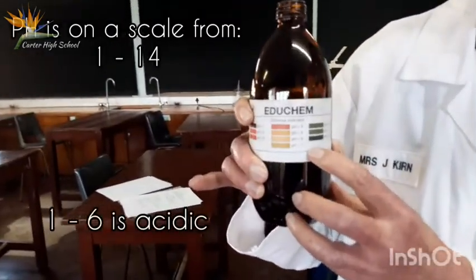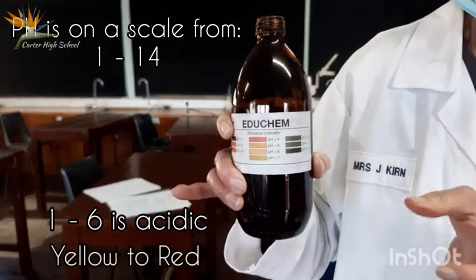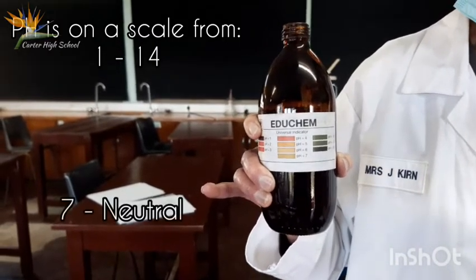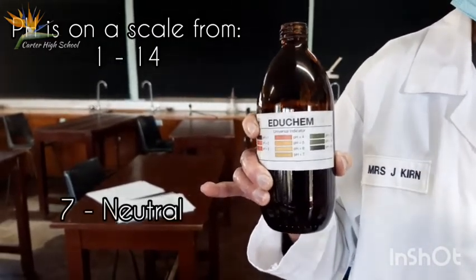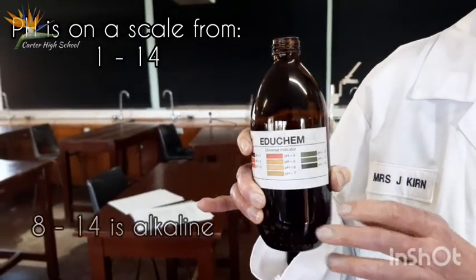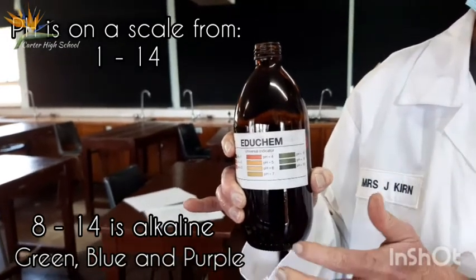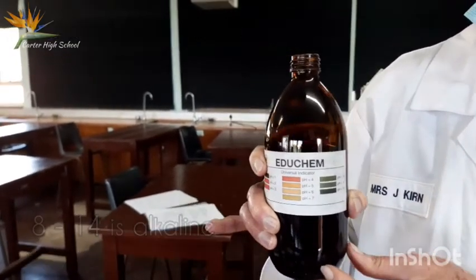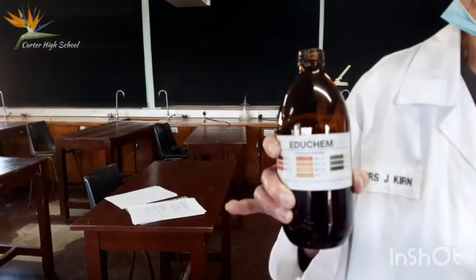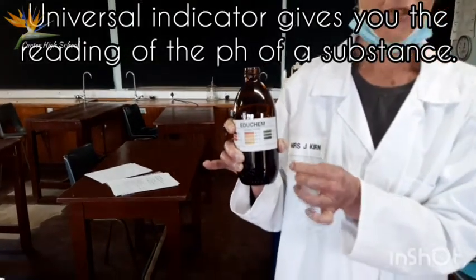From 1 to 6 is acidic, and it will have specific colors, sort of from the yellow to red is the acids. The middle color, which is a pH of 7, because halfway between 1 and 14 is 7, is neutral, which is green. And then 8 to 14 will give you the greens right through to the blues and the purples, and those are alkaline. So the usefulness of universal indicator is that it not only tells you what is acidic or alkaline, but actually gives you the pH reading of it.